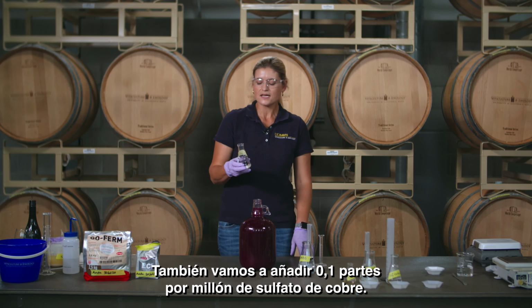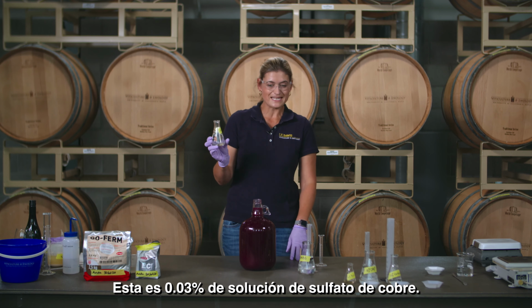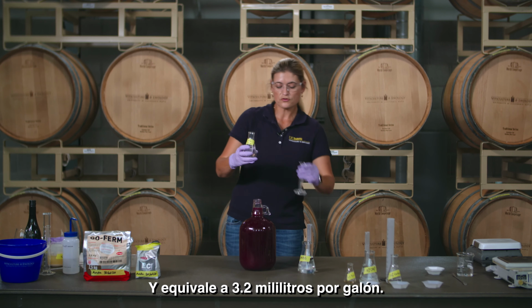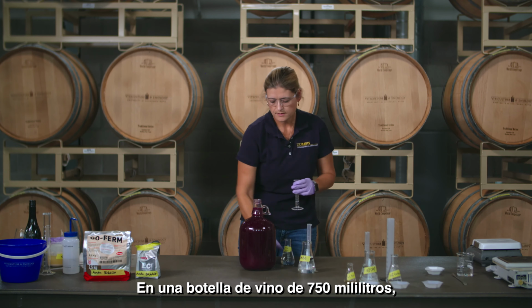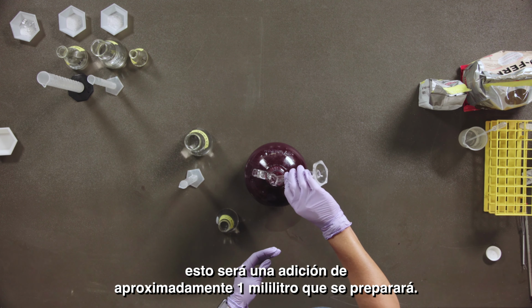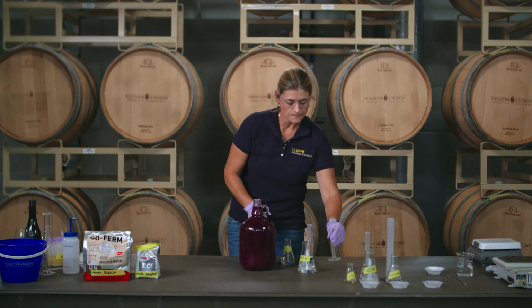We are also going to add 0.1 parts per million of copper sulfate. This is a 0.03% solution of copper sulfate, and it equates to 3.2 milliliters in 1 gallon. In a 750 milliliter wine bottle, this will be about a 1 milliliter addition that you will be making.